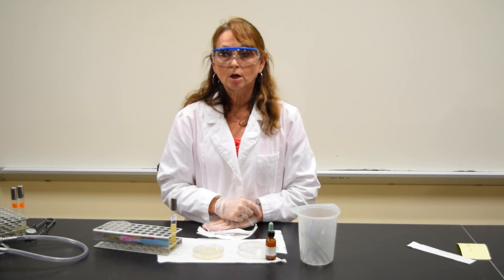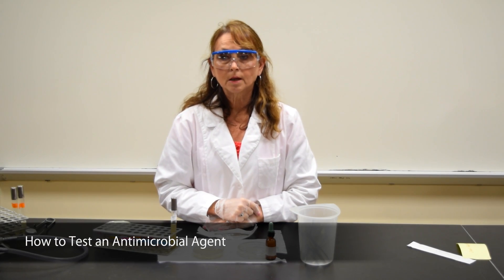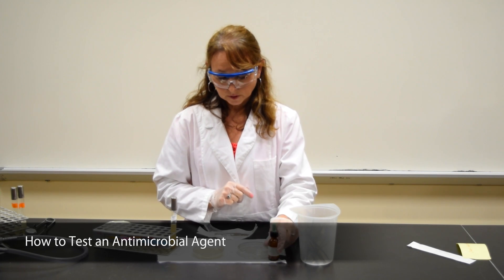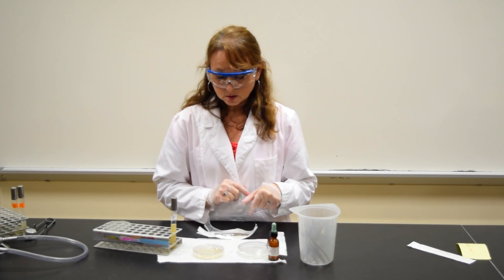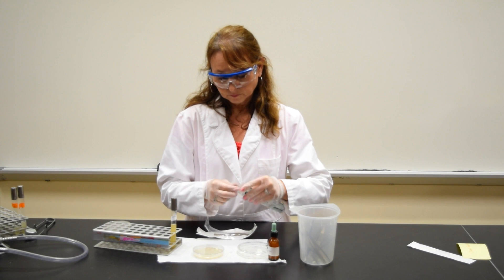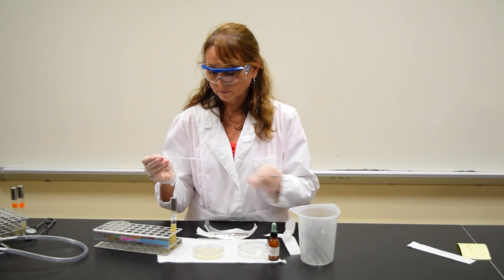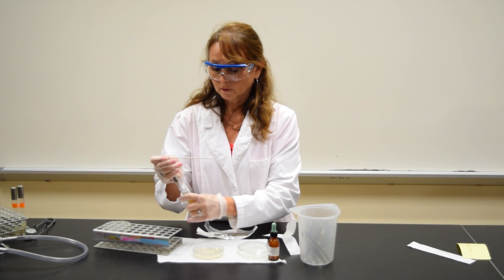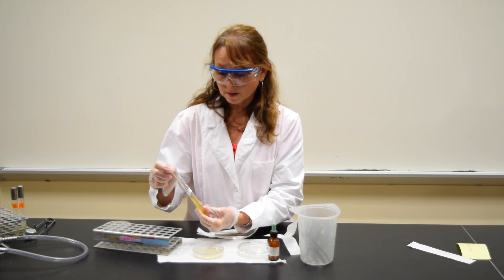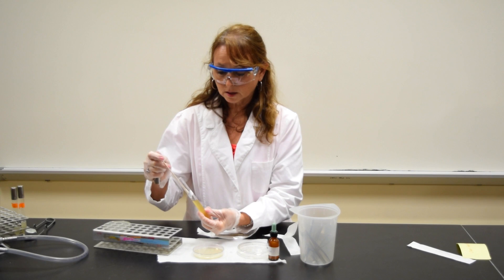This demonstration is to show you how to test an antimicrobial agent like Lysol. I'm going to start by taking a swab, opening up the package, dipping it into the container — the test tube containing my microbe. In this case, it's Staphylococcus.